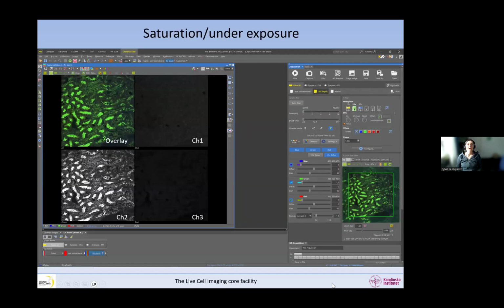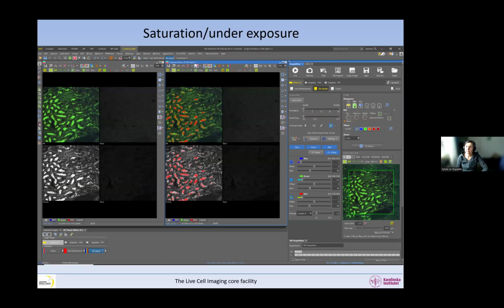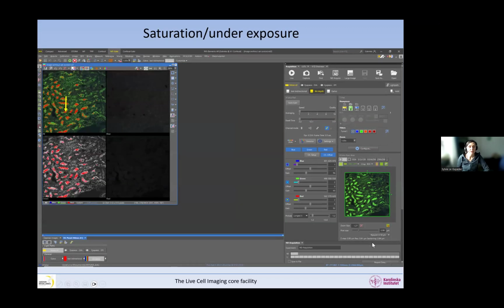Okay, so we see in this image there is an overlay and 3 channels, 1, 2, and 3. We can wonder what is wrong with this image. To start with, we could think that maybe channel 1 and channel 3 are very dim, and that's not very good. But really the problem lies in channel 2. Indeed, it is saturated and not the others. So how do I know that it's saturated? I will show you. So what does that mean, that it's saturated?